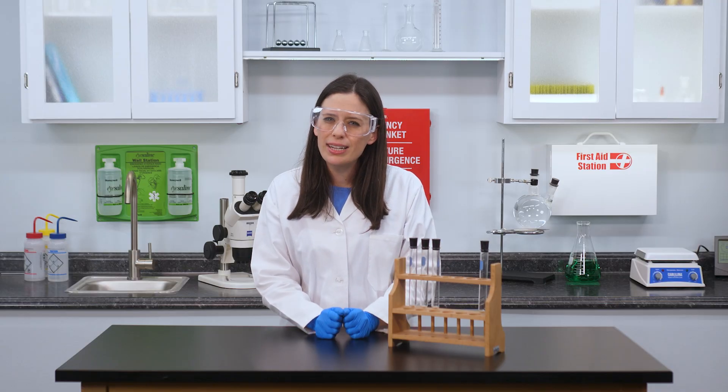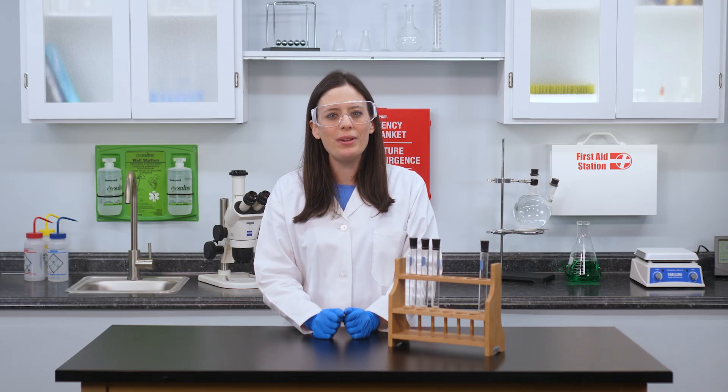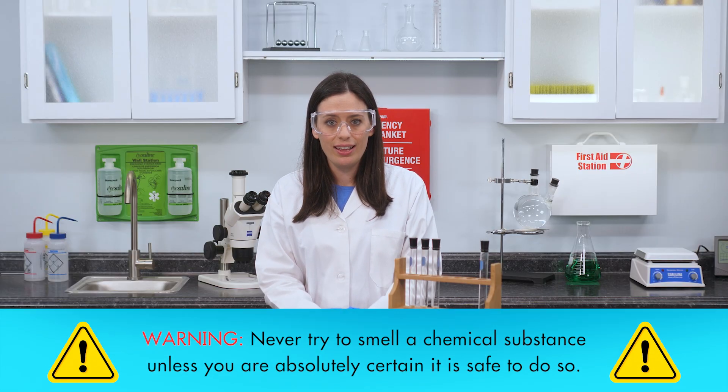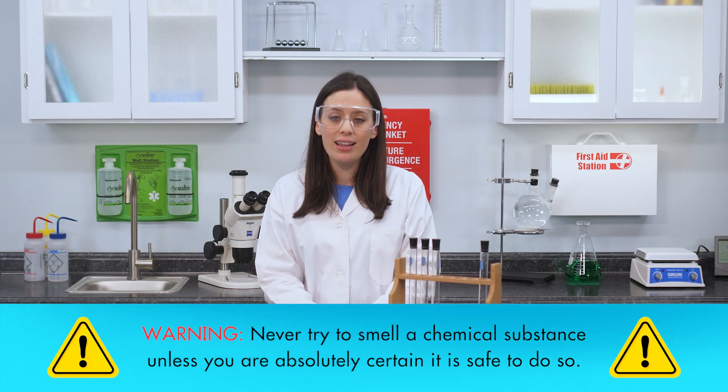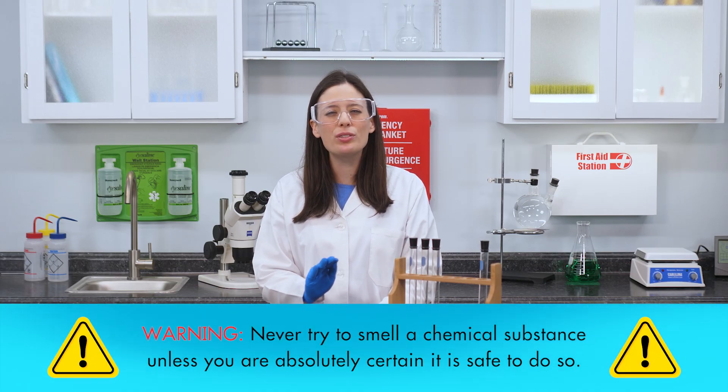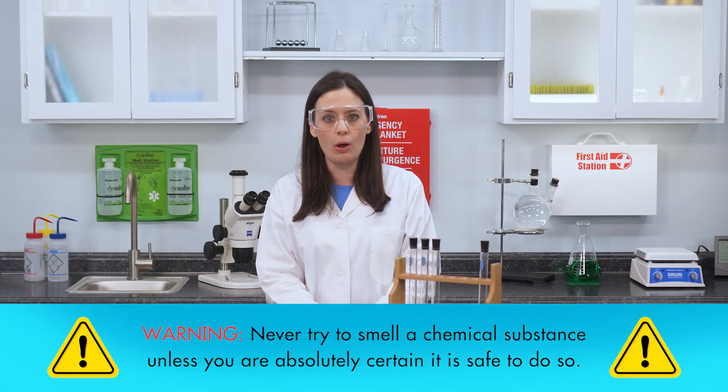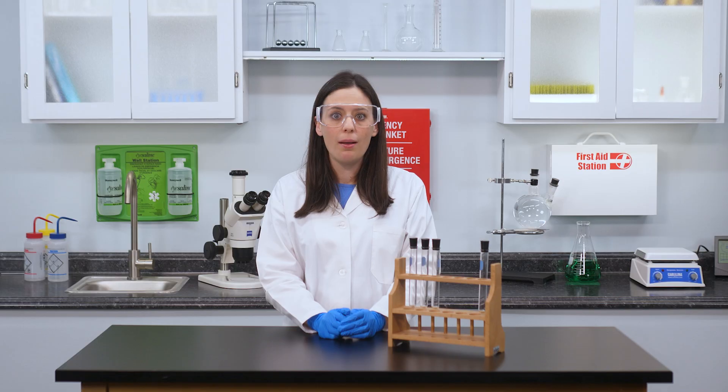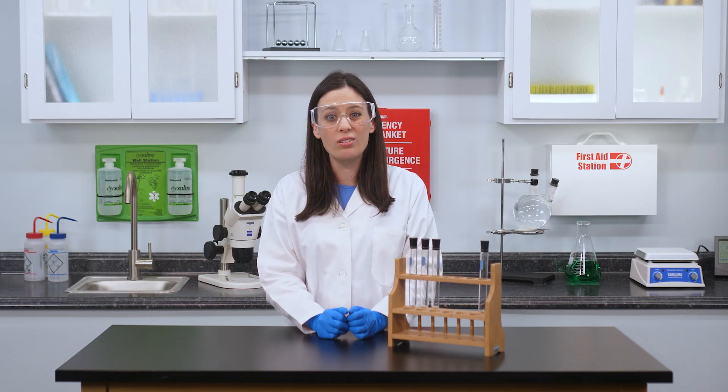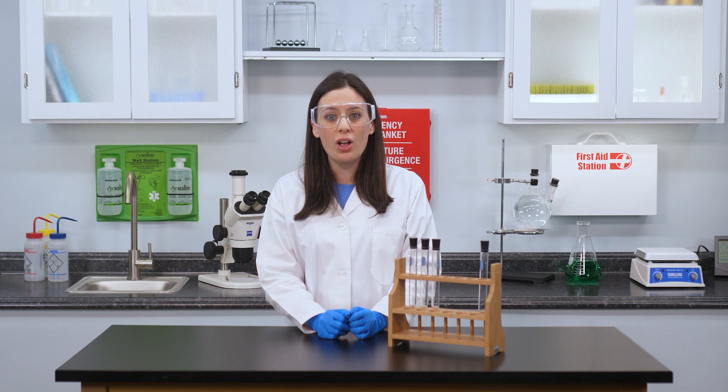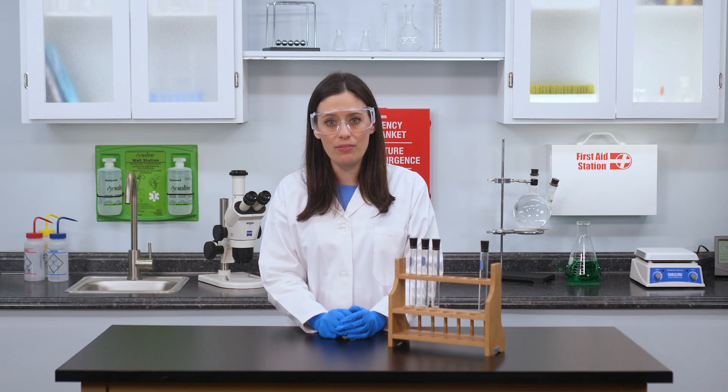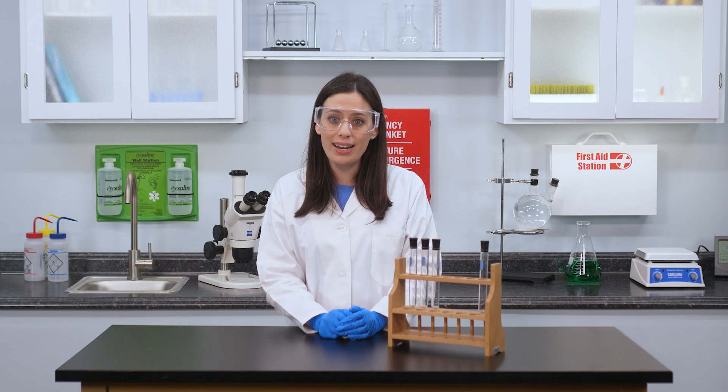What about its odor? Before we determine its odor, we need to issue a word of caution. Never try to smell a chemical substance unless you are absolutely certain it is safe to do so. Hydrogen is safe to smell, but if this was chlorine gas or sulfur dioxide, the results of smelling it could be fatal. Even if you are certain that a substance is safe to smell, you should never sniff it directly.